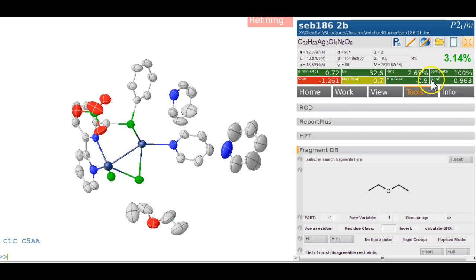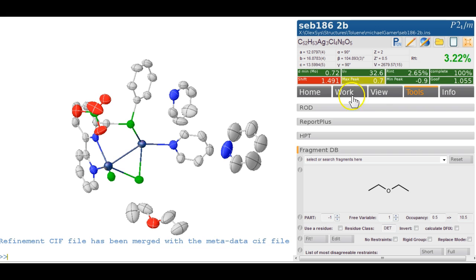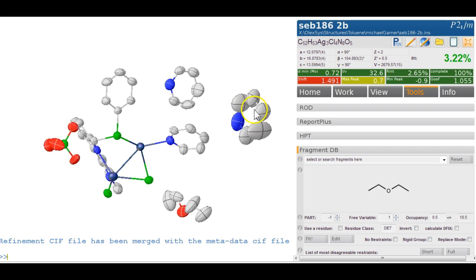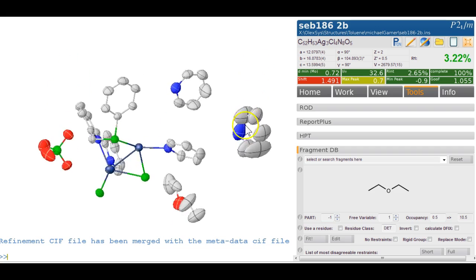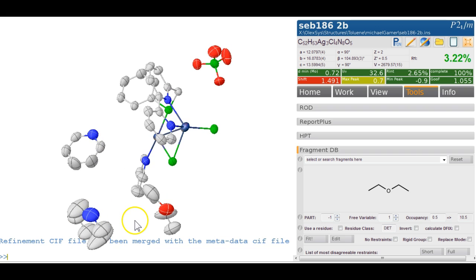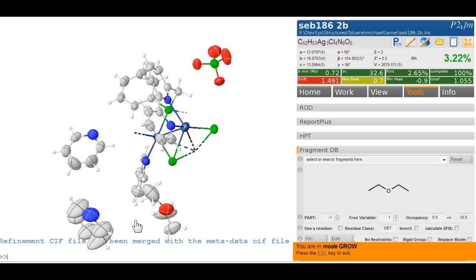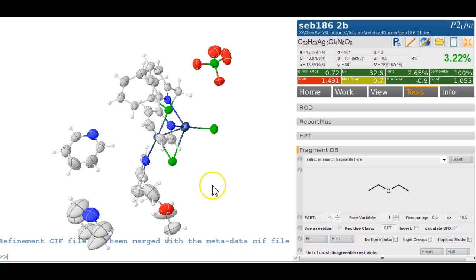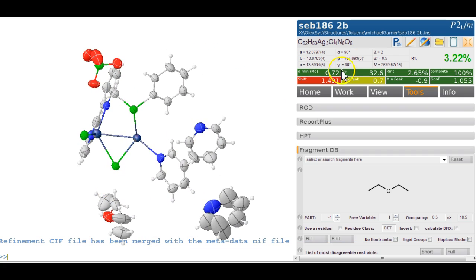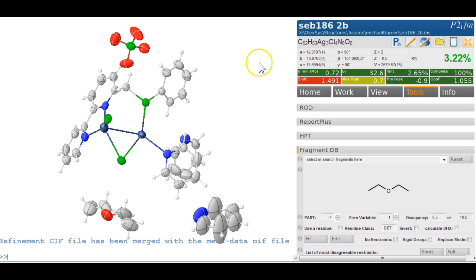So it looks nice, and the R factor is 3.22. So the R factor hasn't actually gone up significantly, and we've got something that is not ideal. And I'm not advocating that this is the final solution, but for something that we did in 5 minutes, it's not a bad starting position to finish that structure off. So we now have no significant peak left, and what's moving? 1.49. Let's have a look.